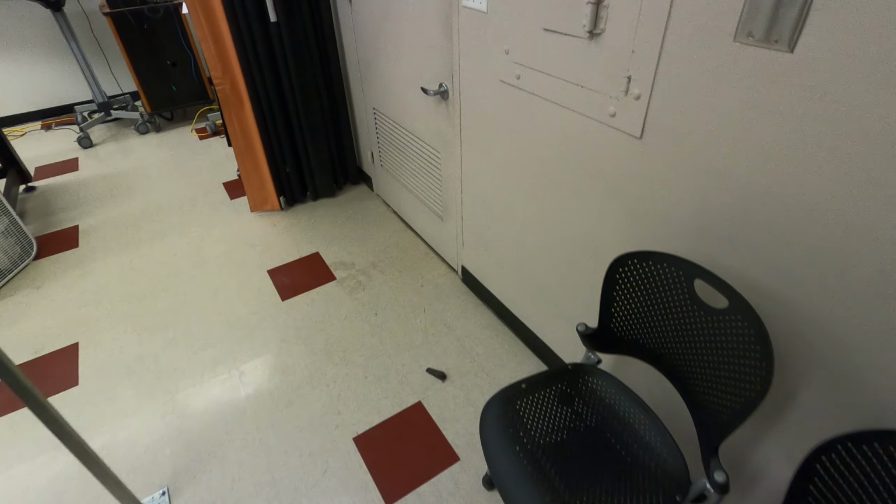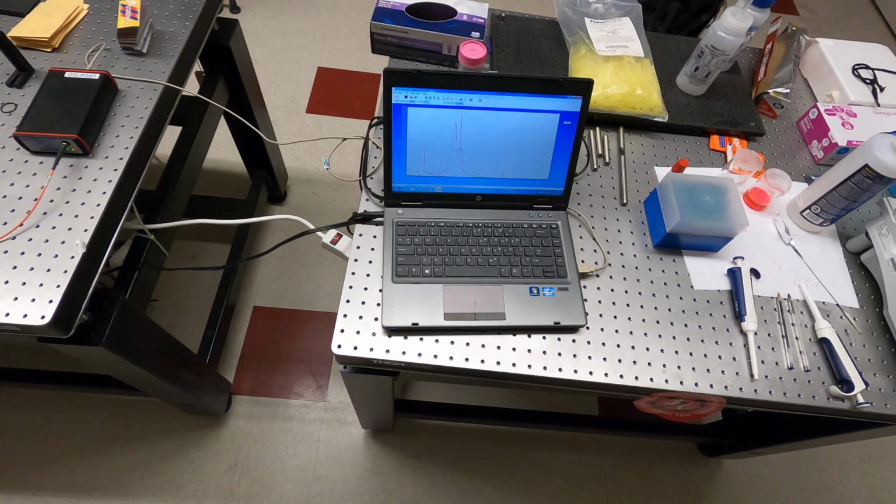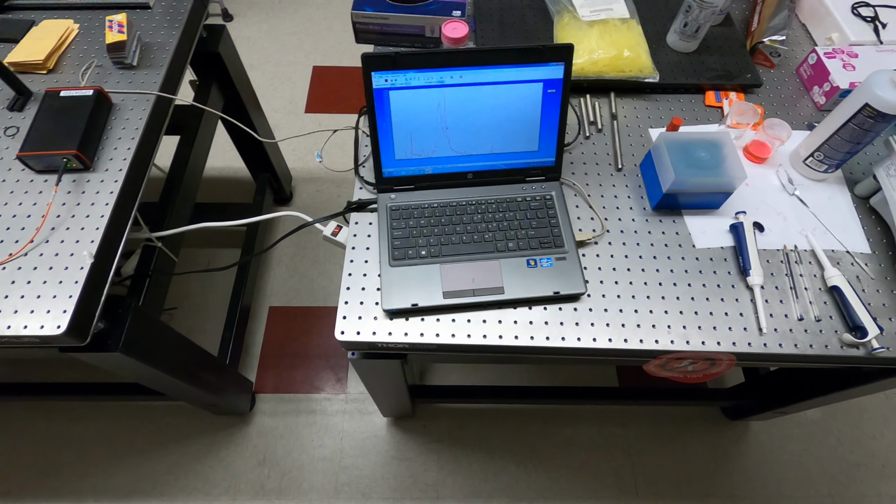So let me turn this off. And that should disappear. And yeah, you can see that I still have some peaks here. These are damaged pixels on the CCD, but the spectrum is very nice. So I can increase the integration time a little more. Let's say 1000. It's hard to see from here, but I doubled my signal. Okay, and now that the lights are on, I can see the peaks back.